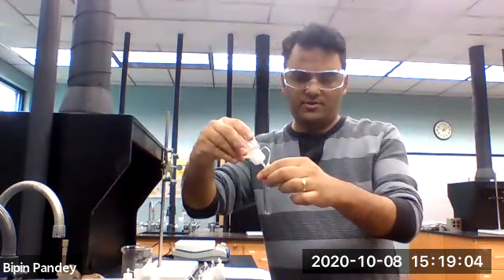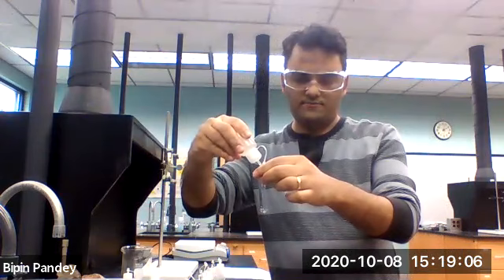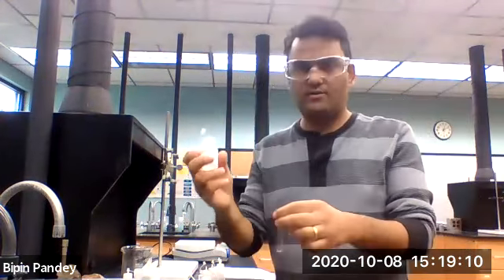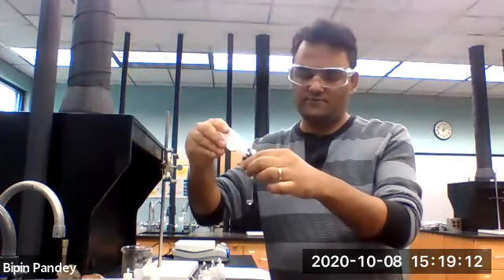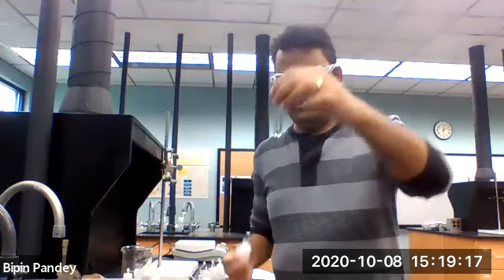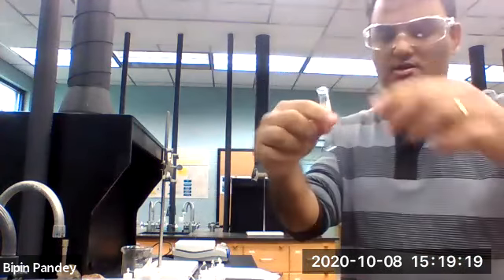Take 5 drops of sodium chloride. Add hydroxide to it, 5 drops. So nothing happened, clear solution, no reaction.